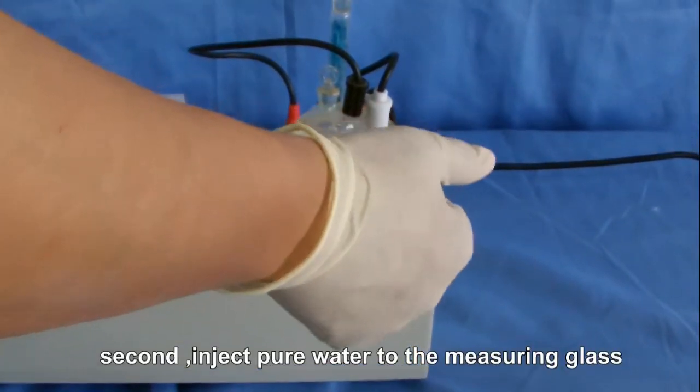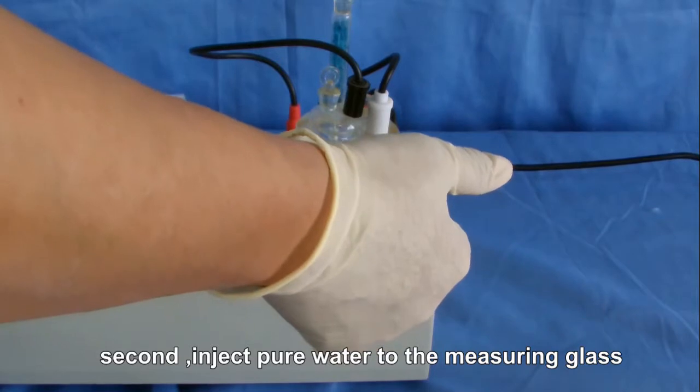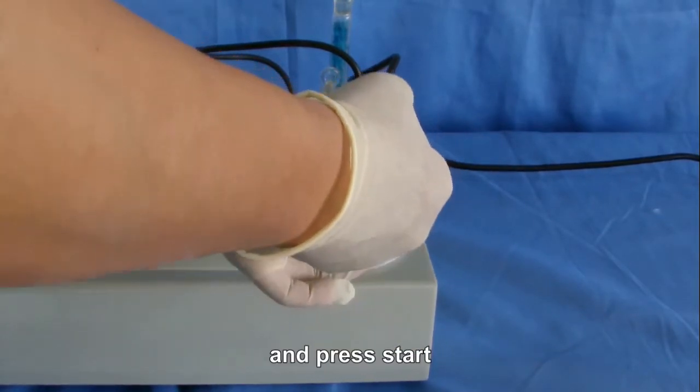Second, inject pure water to the measuring glass and press start.